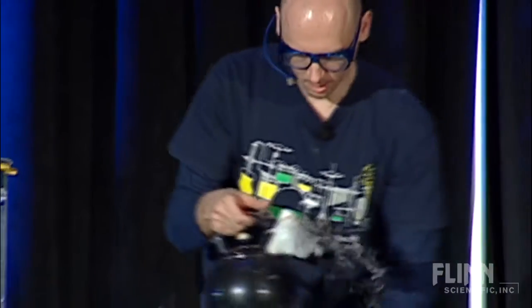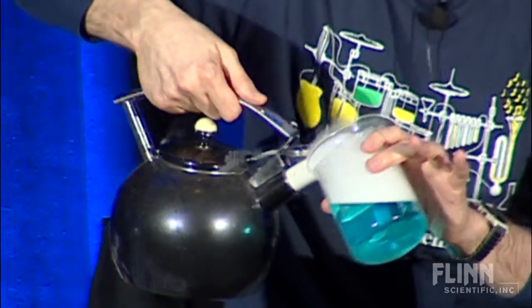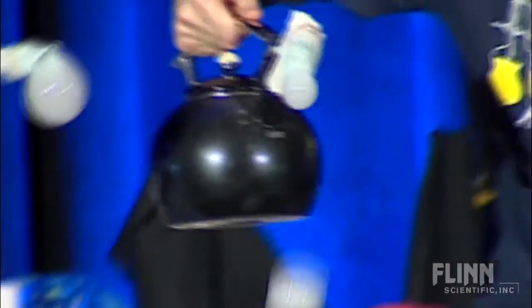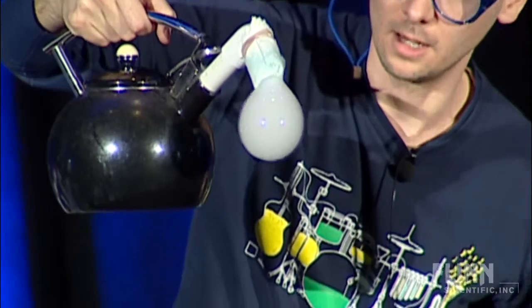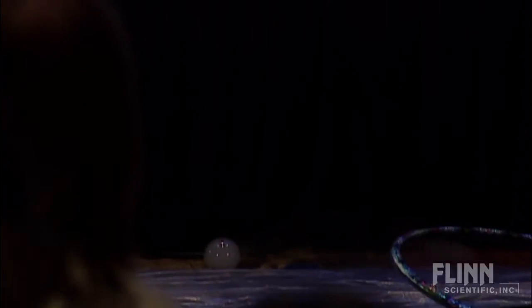Once enough comes, it should fall off the tip. While that one is going, we could also use the kettle. I know we have some friends here from the U.K. across the pond. I've been talking to a few of them and they were saying they can't get a good cup of tea — and this is for you guys. It's the same concept, and once it breaks the kids come and touch it and it evaporates. We call this 'leaky faucet.' Or in Chicago, when you're walking around after the conference, you could see the signs that say watch out for falling ice — so that's kind of important.